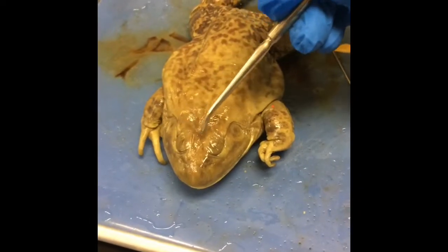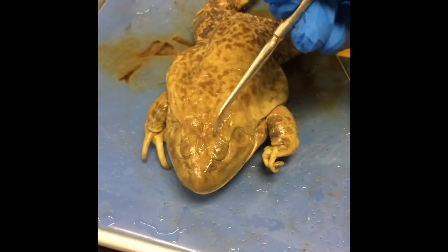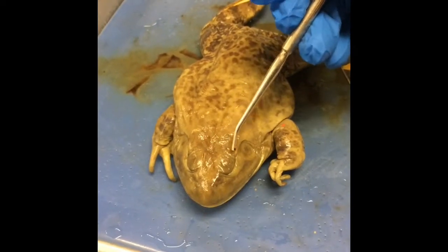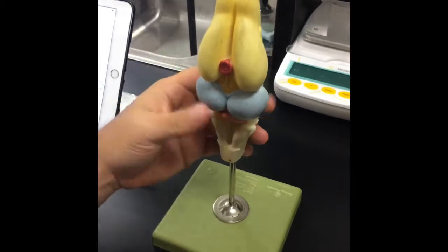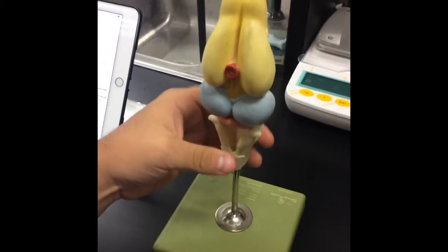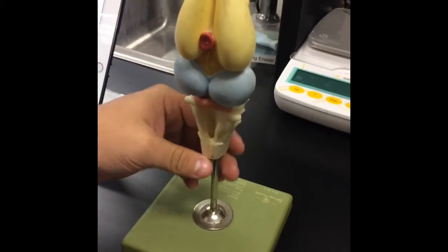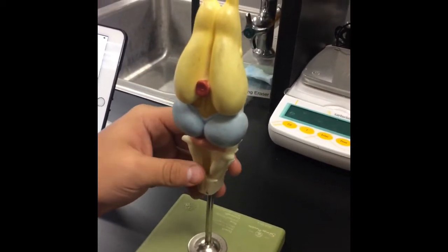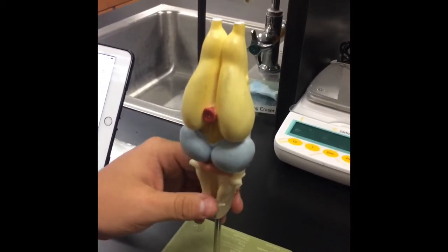These are the eyes of the frog, and they connect by the optic nerve to the brain. They give visual impulses from the eye to the optic lobe. Here's the central nervous system of a frog. The frog's central nervous system is made up of two organs, the brain and the spinal cord. The brain is contained in a bony structure known as the brain box or cranium, and it protects it from external shocks.